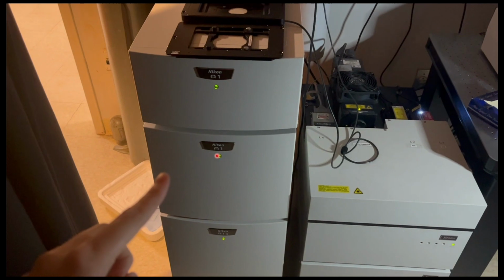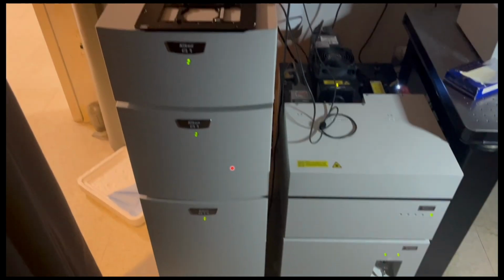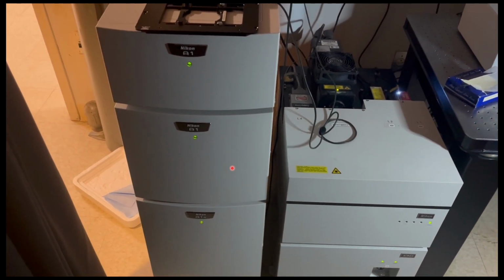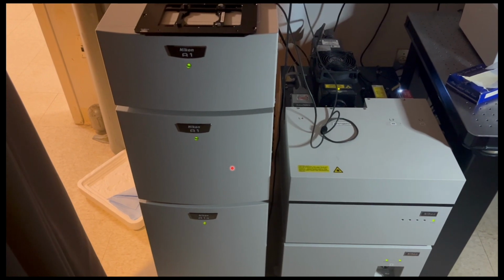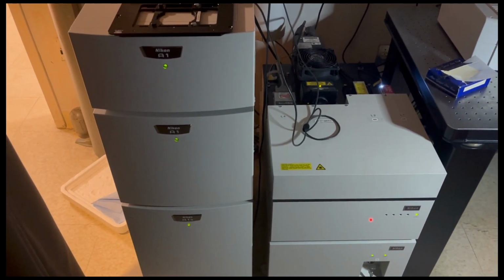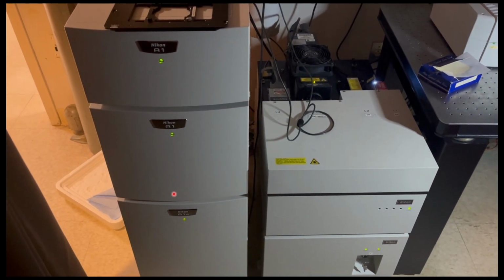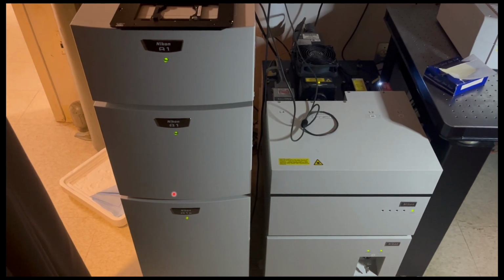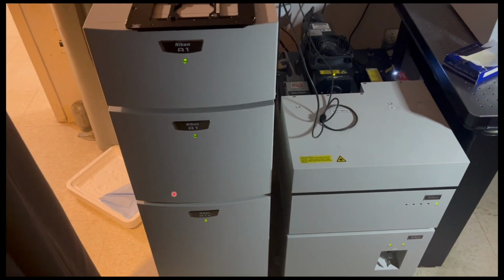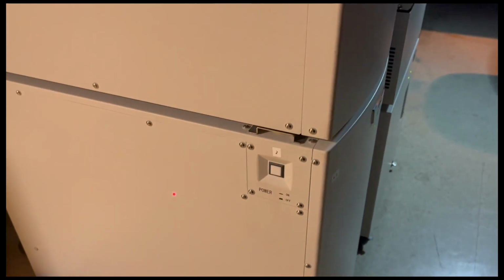The second box that goes on is this master controller. What the master controller does is it connects the lasers to the microscope to the computer. It acts as a communication hub for the microscope. Once you've turned on box 1, it's important to wait about 30 to 45 seconds before turning on box 2. That is because it relies on the lasers being fully booted up before it can be turned on so that it can accurately connect the lasers to the computer and to the microscope.